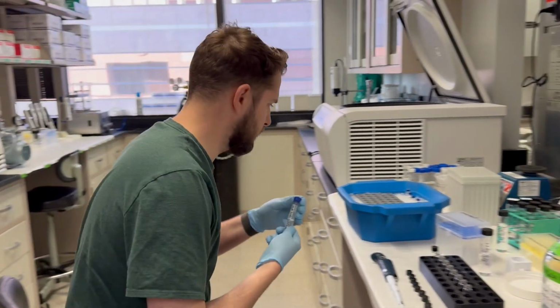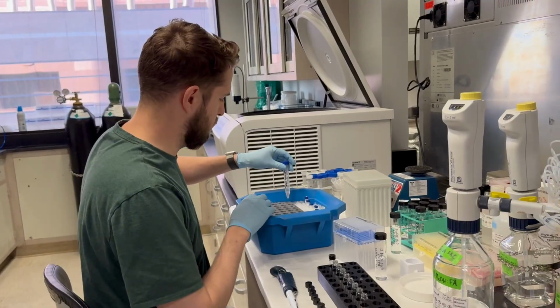Yeah, that one's perfect. Oh yeah, that's fine. That's okay. Yeah, this is perfect. Yeah, we just need the one. Okay, I can. Thank you.